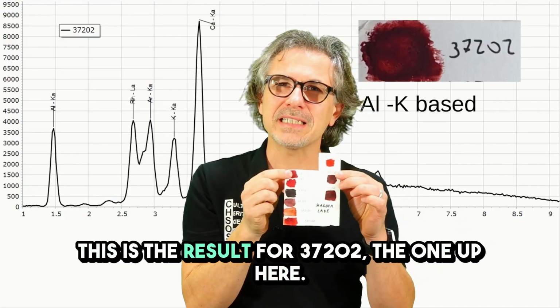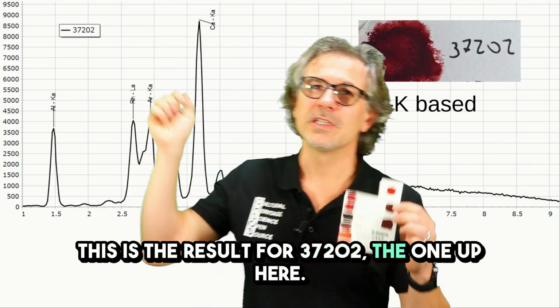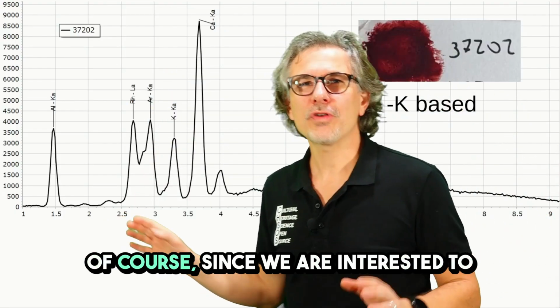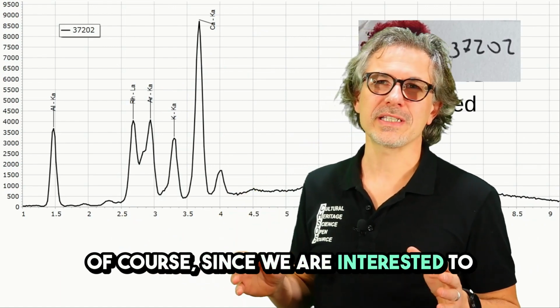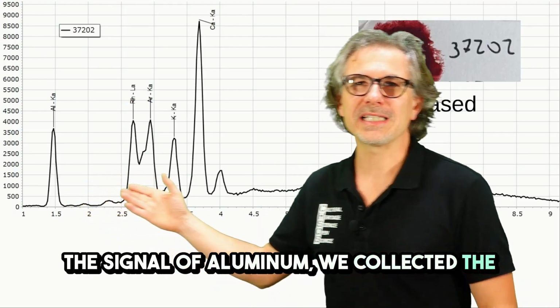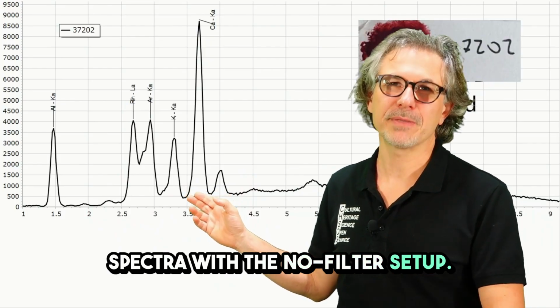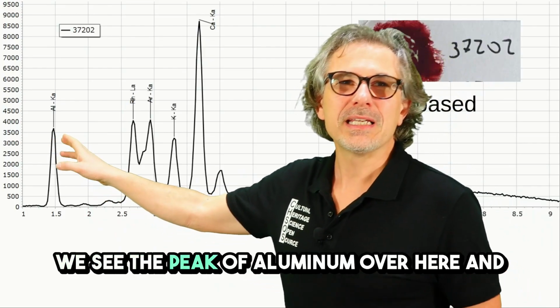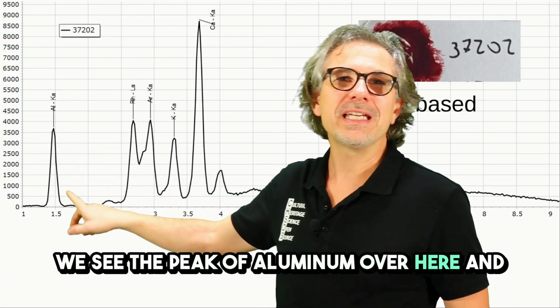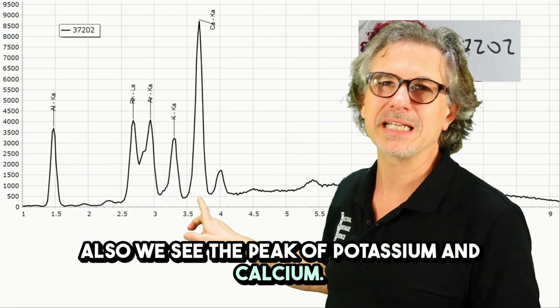This is the result for 37202, the one up here. Of course, since we are interested in the signal of aluminum, we collected the spectra with the no filter setup. We see the peak of aluminum over here, and also we see the peak of potassium and calcium.